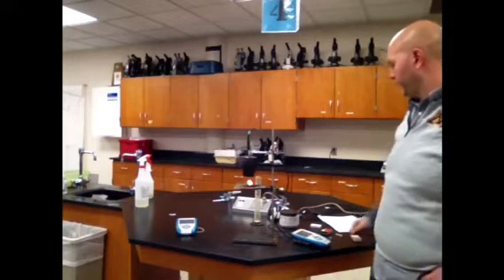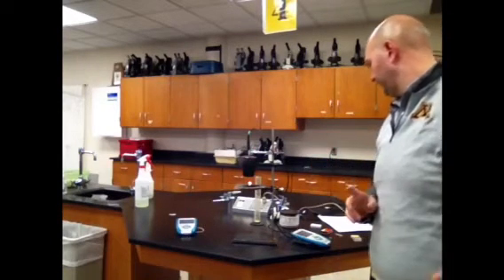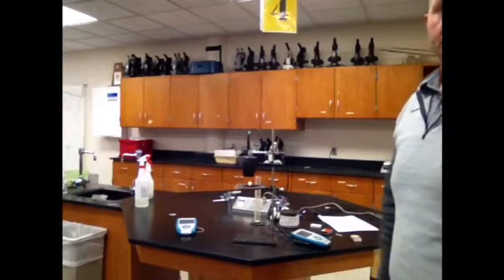Just a burning cashew. Good times. Seriously, still going.